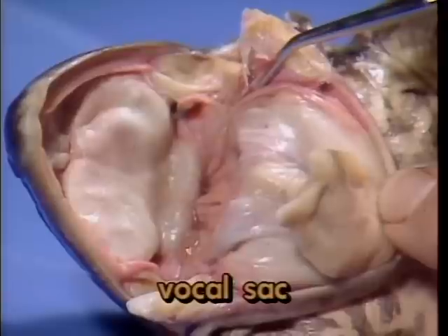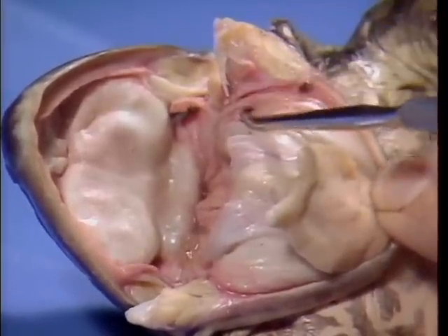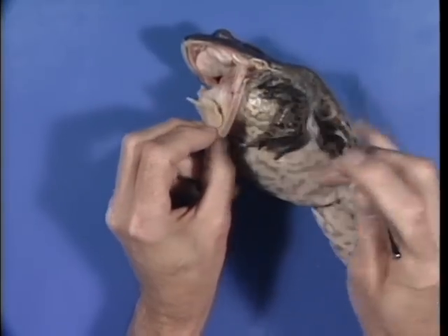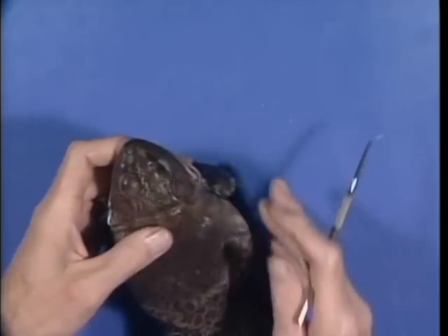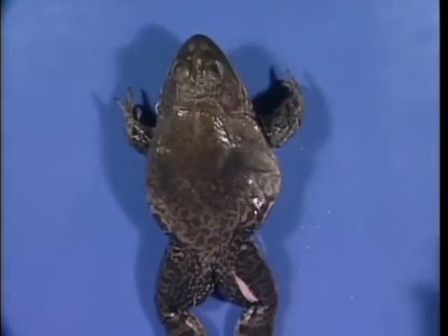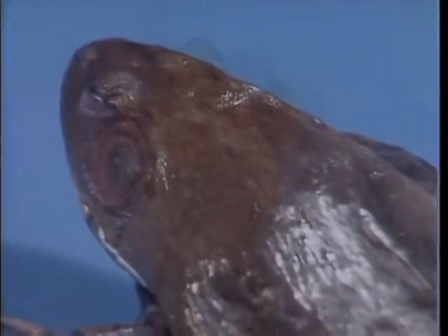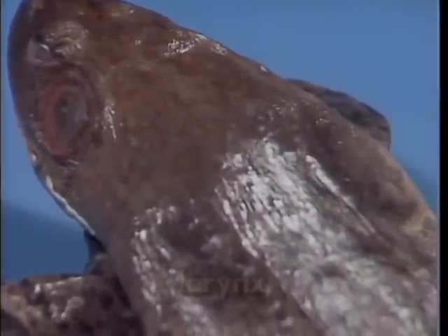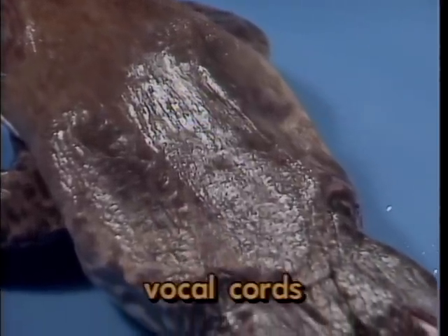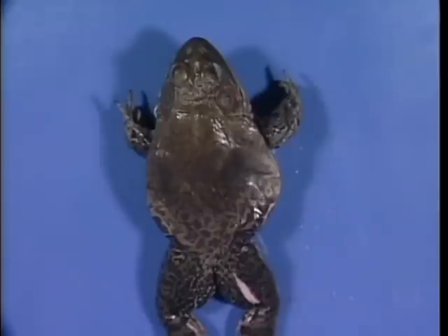Air passing into the vocal sacs allows each to act as a resonating chamber while the male is producing the mating call. Mating calls are an important part of courtship in frogs, and the range of sounds among the many species extends from croaks to snores to loud trilling sounds. The mating call actually originates in the larynx, just posterior to the glottis. Air rushes across the vocal cords found in the larynx, causing them to vibrate.